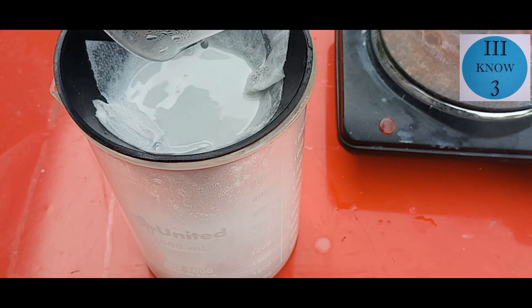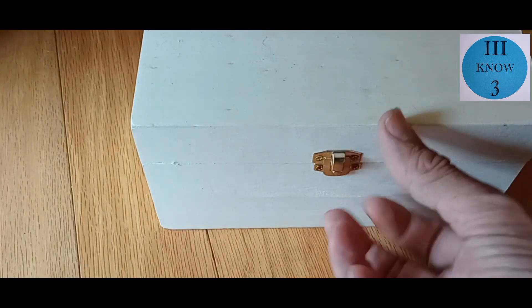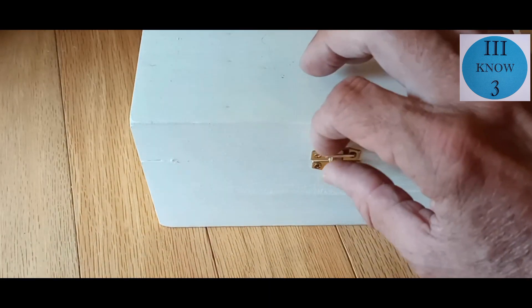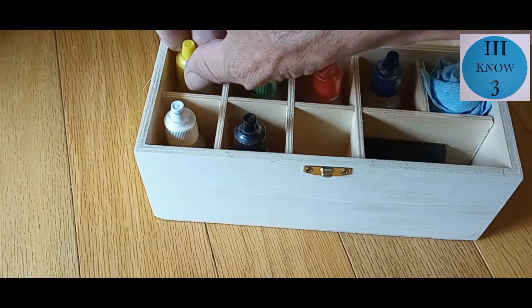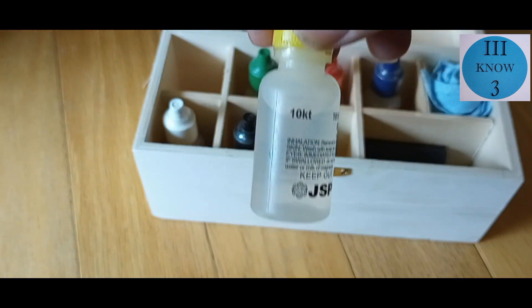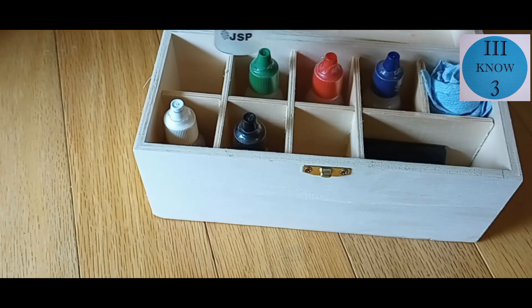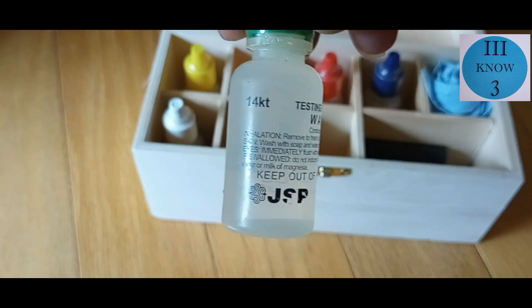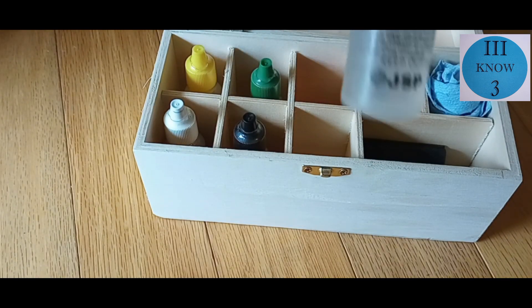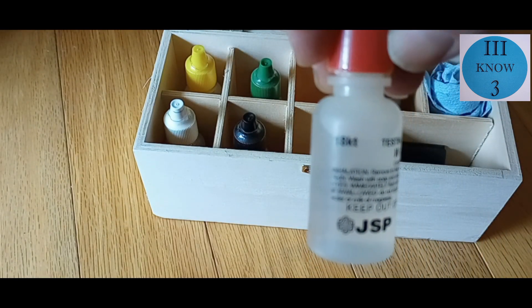I wish I had some potassium dichromate. Let me see what I have in my precious metals testing box. You should really have one of these if you're into metals. There's a solution to test 10 karat gold, 14 karat gold, and here's 18 karat.